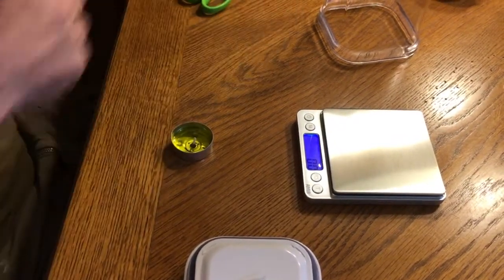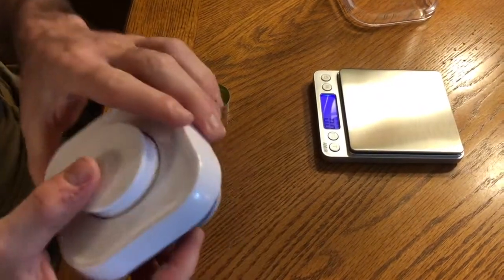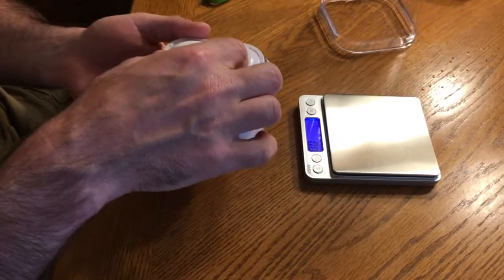In this demonstration we're going to do a closed system burn — that's part of this lesson. I put some tape here on the back of a lid for an airtight container, and we're going to put this on this side and tape it to it.